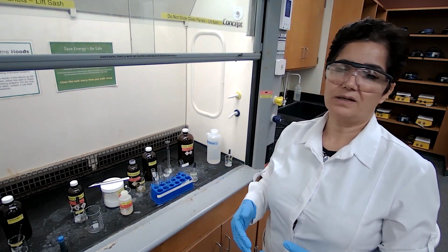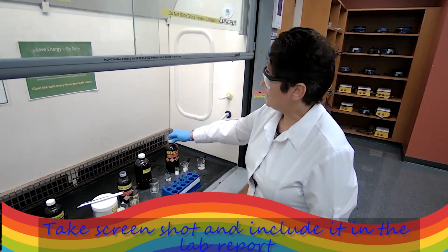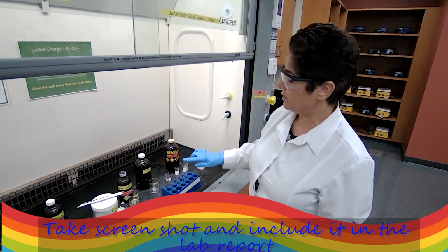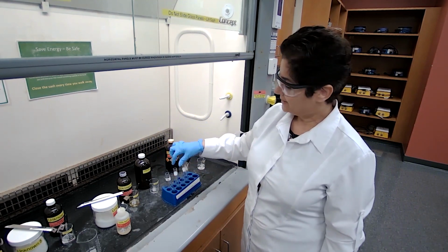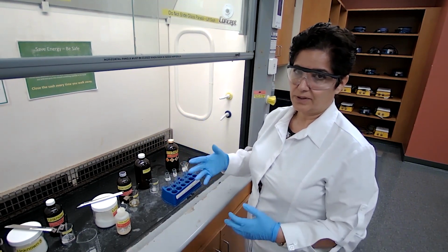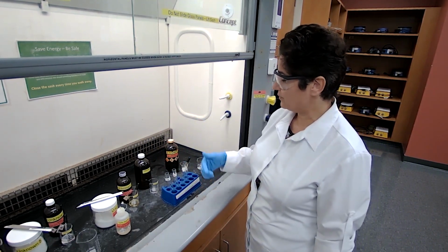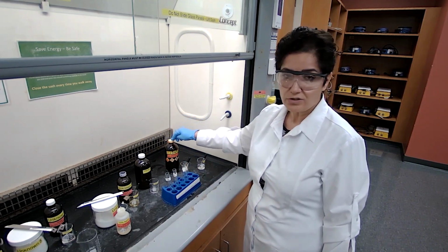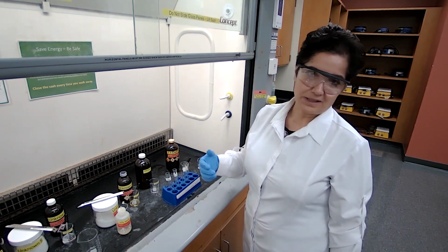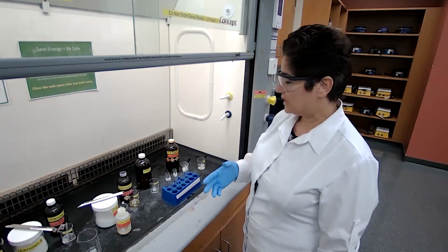Next step would be classification. We are going to test the remaining unknowns, which is unknown 1, 4, 5, and 6. These are the ones that dissolved in sulfuric acid, but did not dissolve in water, HCl, and sodium hydroxide. We're going to test with 2,4-dinitrophenylhydrazine. If a yellow precipitate forms, it means that it's either an aldehyde or a ketone.